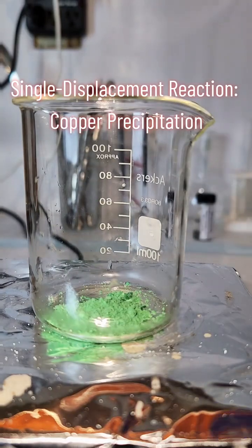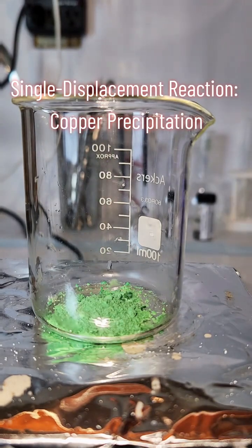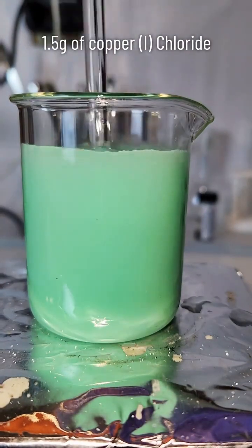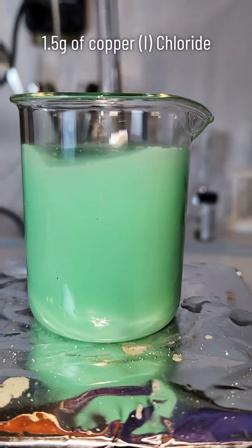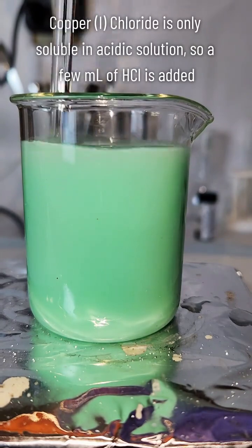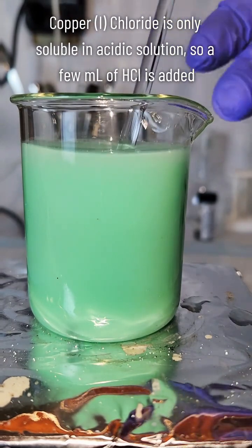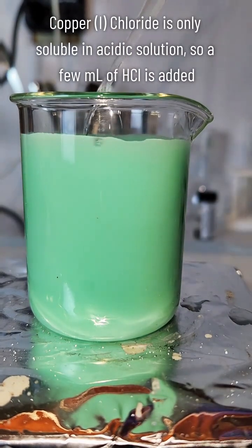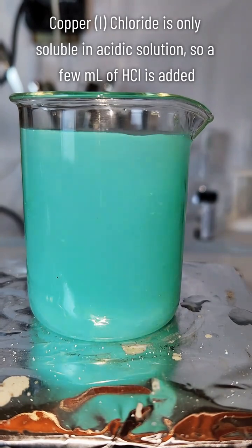A single displacement reaction is one of the four primary types of chemical reactions, and today I'm going to demonstrate a single displacement between copper chloride and zinc metal. This copper 1 chloride was a primary byproduct of an extraction of gold I did from computer parts a few months ago, so if any of you are interested in how I dispose of or recycle my chemical waste, this is a big way that I do it.